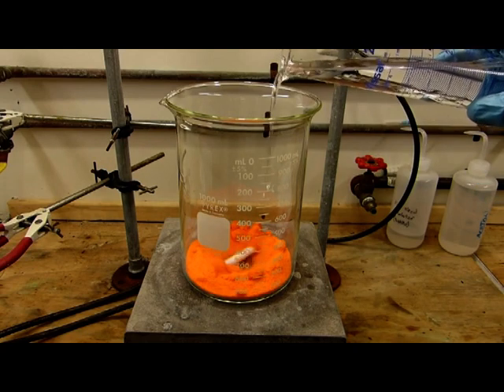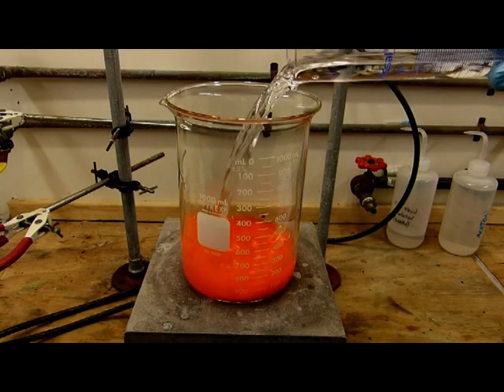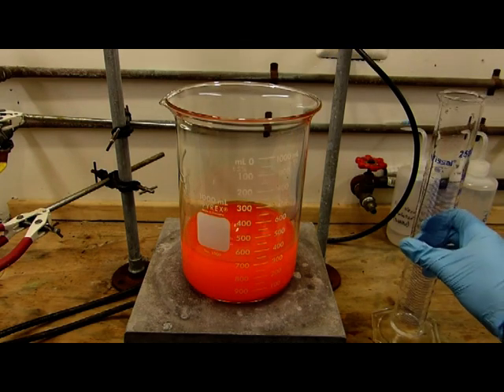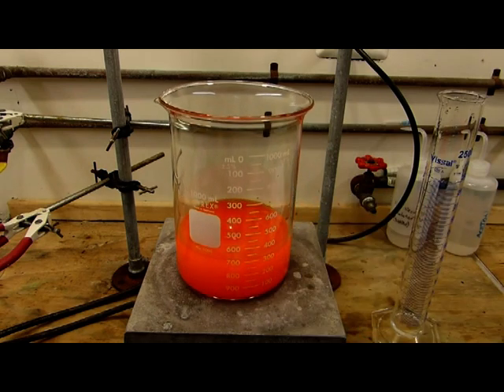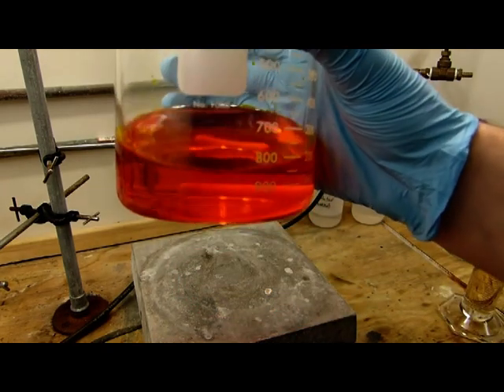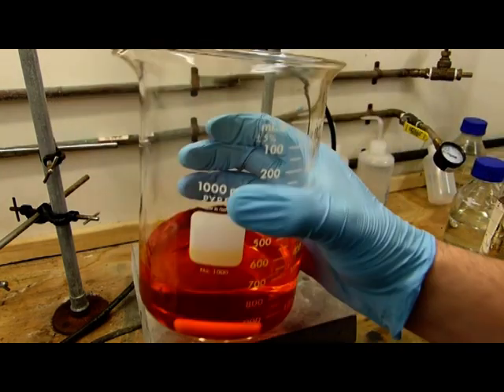We're going to make that into a solution here, and slowly stir this until it is completely dissolved. It may take a little bit of heating in the microwave. Okay, as you can see the dichromate has completely dissolved. It's now a clear orange solution.